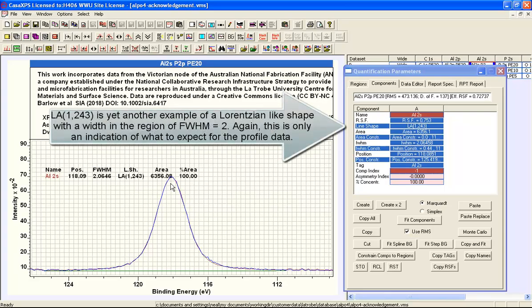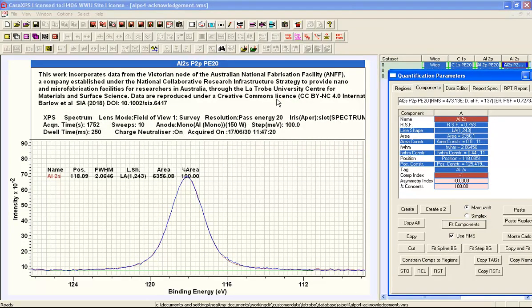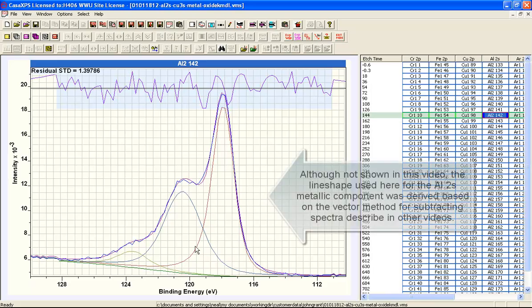This is aluminium phosphate, and it's once again data that's in the Latrobe database. So it's very useful to have these type of data when you're trying to work out the types of shapes that you might expect in a peak model, such as the depth profile that we're interested in. So when we consider the peak model, we can happily introduce two peaks that should be somewhat Lorentzian, and then we have another peak that has a slight asymmetry. This is typical of aluminium metal to have a slight asymmetry.